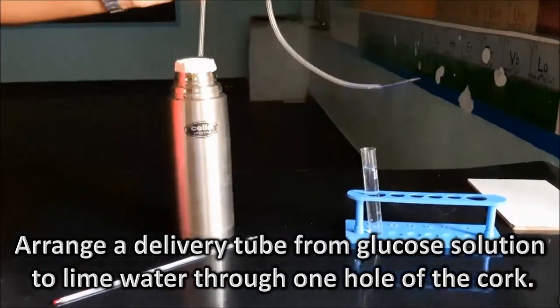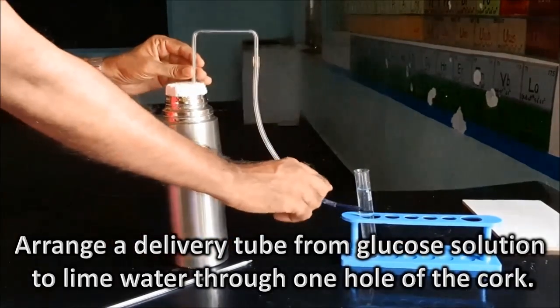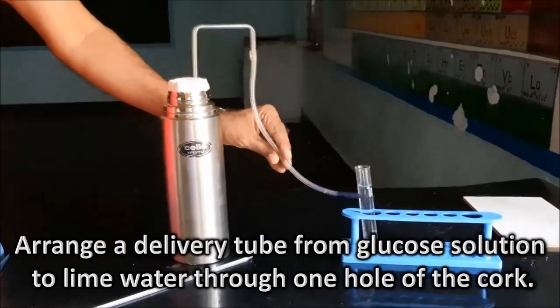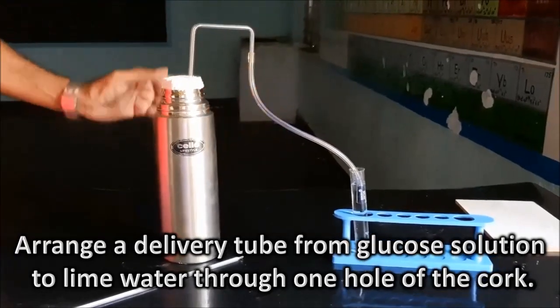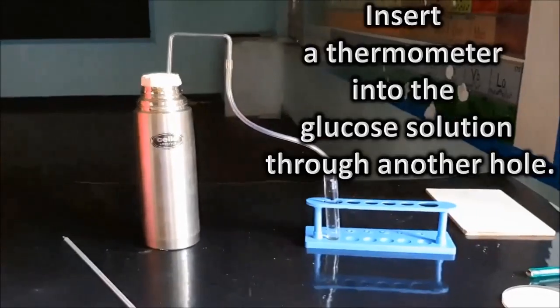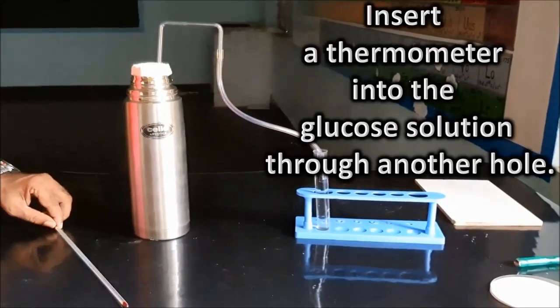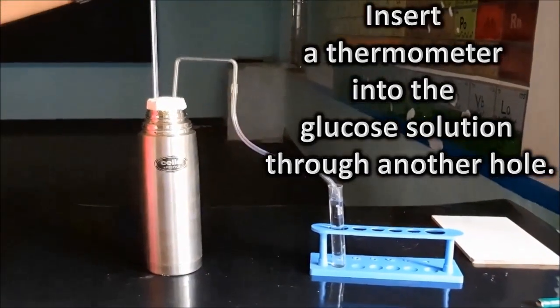Arrange a delivery tube from the glucose solution to the lime water through one hole of the cork. You can see one end of the delivery tube is present in the flask and the other end of the delivery tube is present in the lime water. Insert a thermometer into the glucose solution through the other hole.